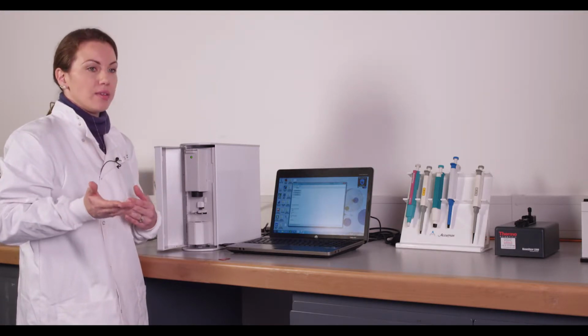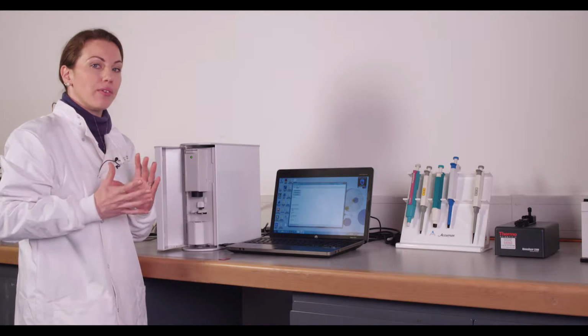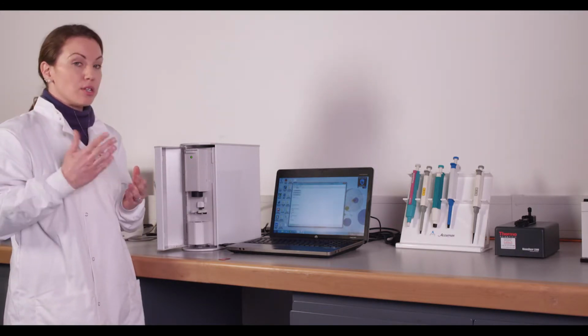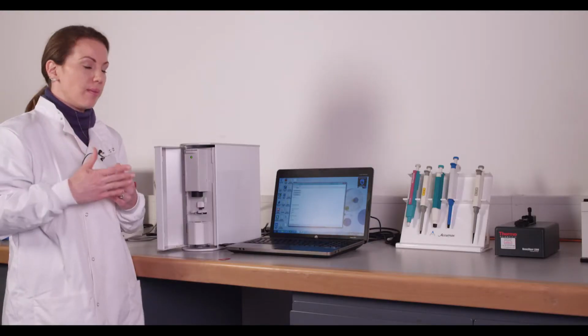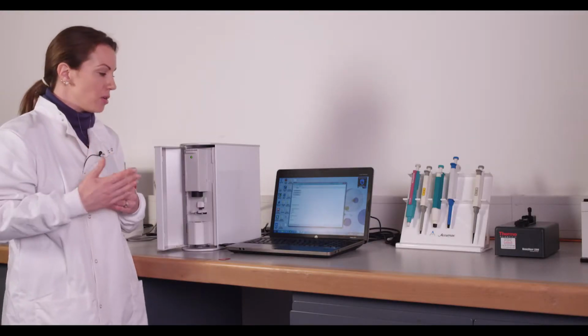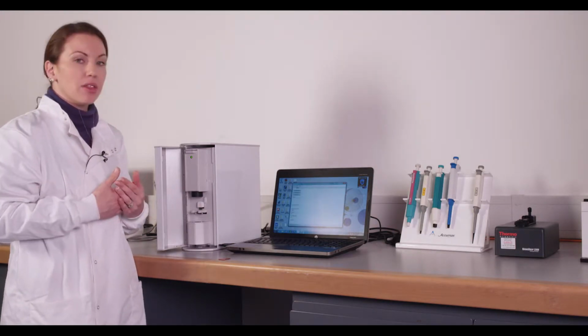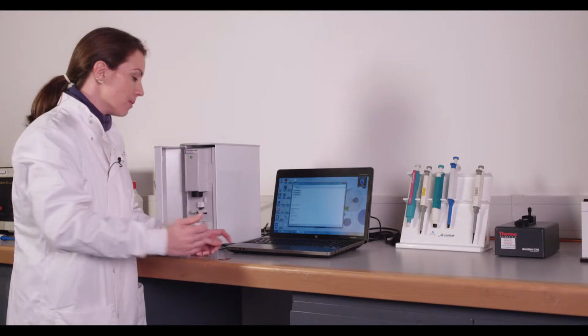So what we found is 10 seconds is typically okay for most mammalian cells when you're looking at the data analysis. However, for smaller cell types like red blood cells, and even smaller, we've done some nanoalgae particles, you need to look at longer intervals of time, 20 seconds, 30 seconds. So it's always better to collect more data than you think you need, which is why we tend to take 30 seconds for all of our data types.